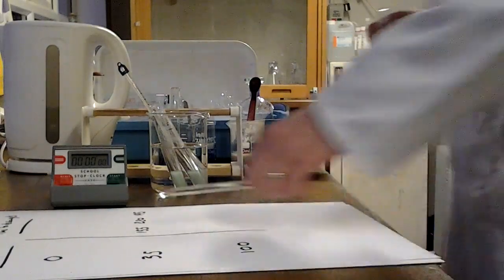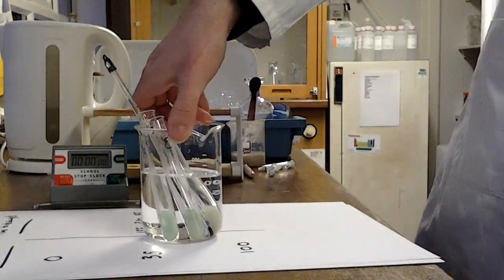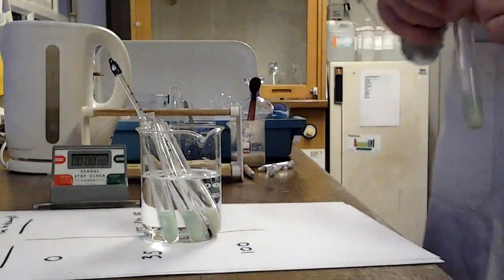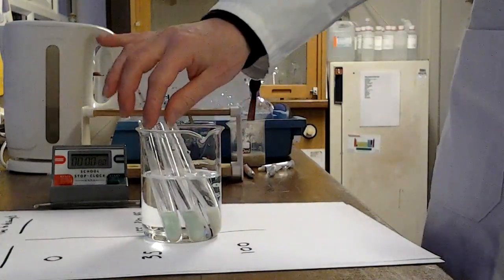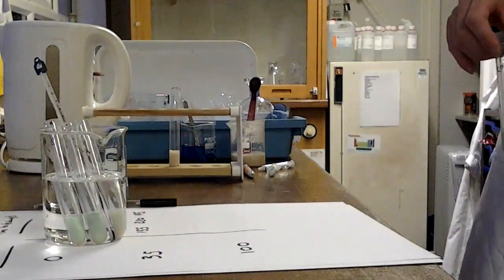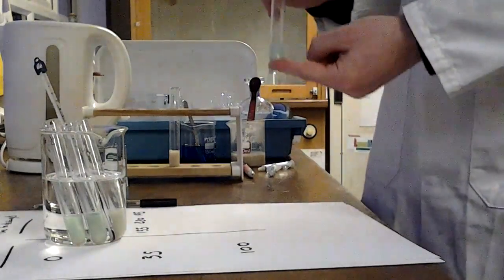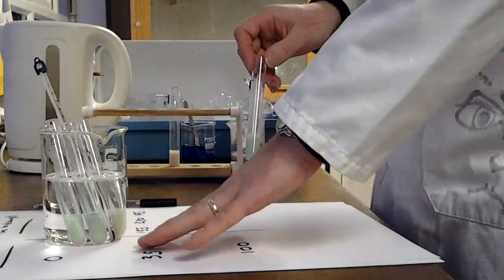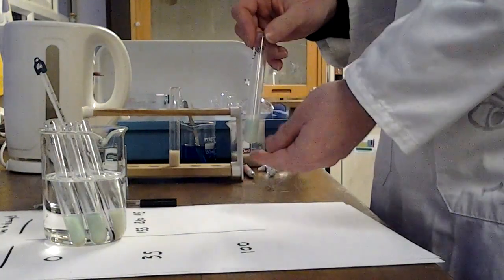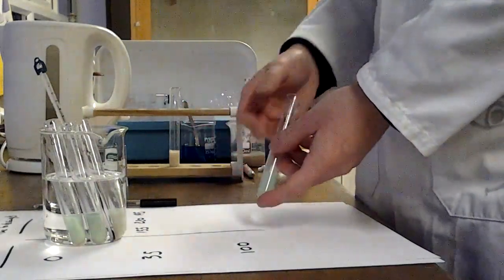Okay, so hopefully you've had a little think about the range you might want to use. I've just got some tubes here that are still decolorising. They're at a slightly higher temperature now, so we're up to I think about 50 degrees. Of course, what you might want to consider whilst you're doing this experiment is that you need to have a control experiment running at the same time. Now remember, a control experiment is set up so that you can just confirm that any changes you observe are due to the active biological factor, in this case the yeast cells. You want to make sure that this methylene blue doesn't naturally decolorise on its own.